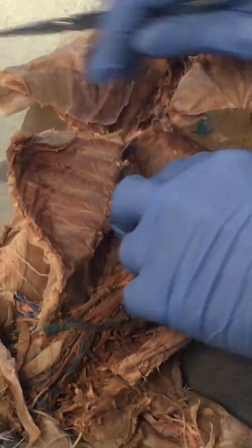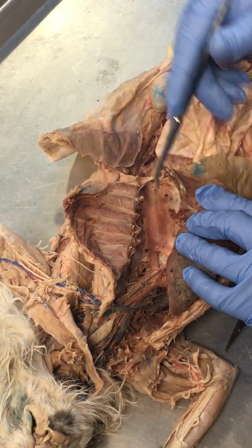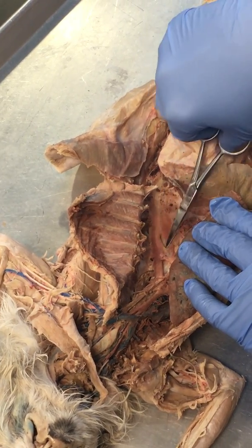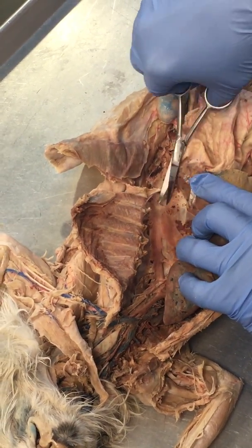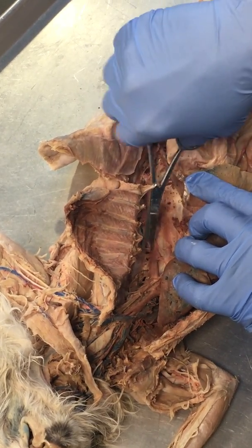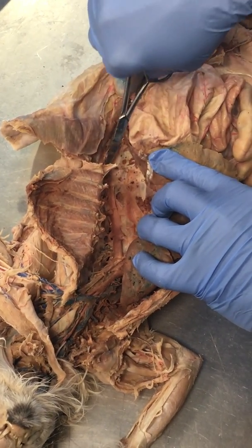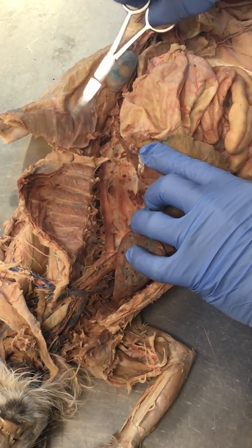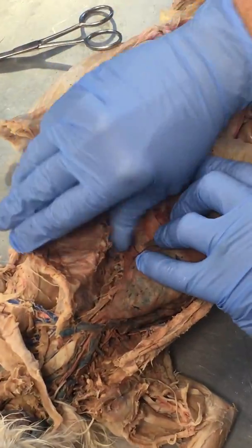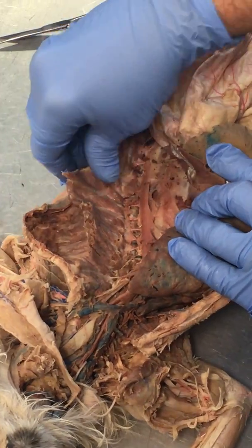And I think the best way to see this, I got to be careful because those are really sharp ribs. Oh, you don't have this dissected, so I'm going to have to do just a very quick. Some of what you did is really good, and these have not been dissected out. But what I'm doing here is opening up the pleural membrane next to each one of the intercostal arteries. So now you can see it, right? So I got to get that too. I don't want to hurt myself, but let's do this. That's better. I know, I heard it too.